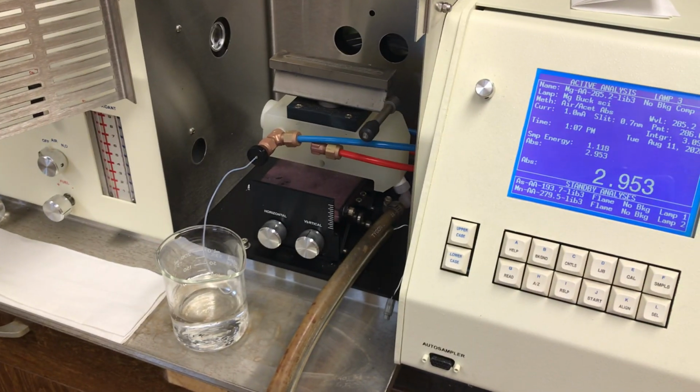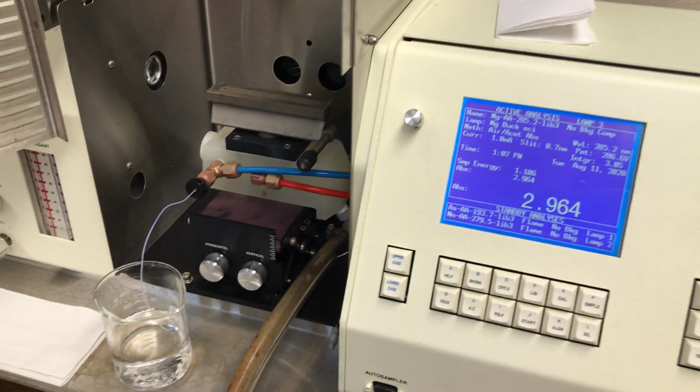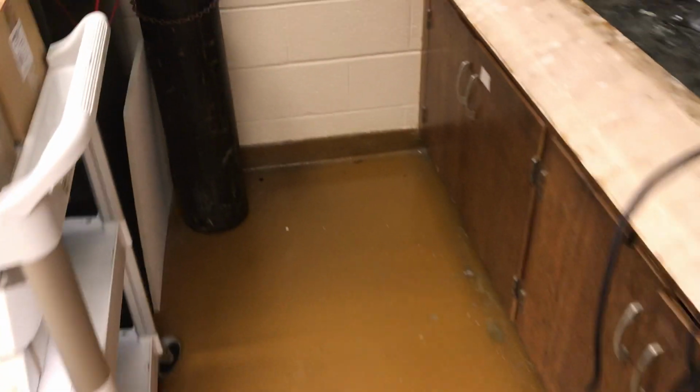Alright, so moving right along here, we're allowing the instrument to warm up. At this point, you will have made a series of magnesium standards, and an unknown would be prepared for you, so those would be ready to go, and I have a set right here that I've prepared. Alright, so also it says that near the instrument we're going to find an acetylene tank. So back around to the side of the hood here is the acetylene tank.